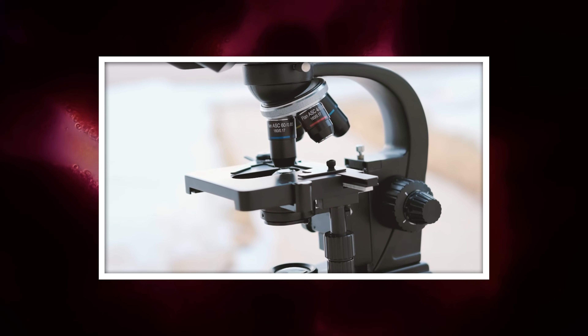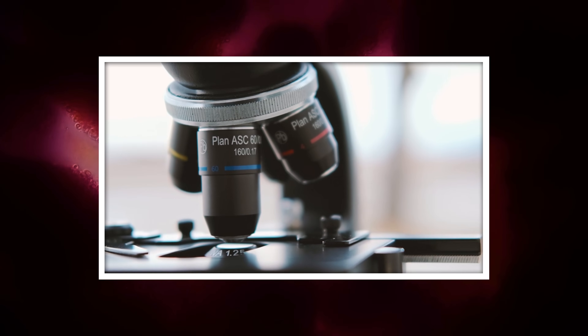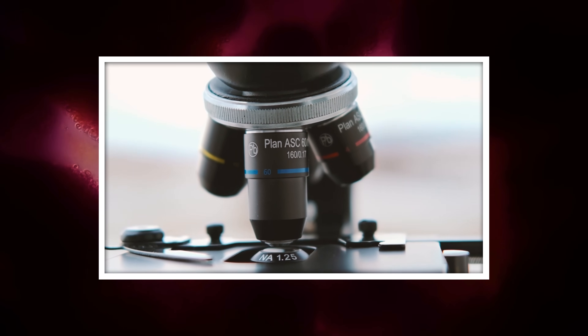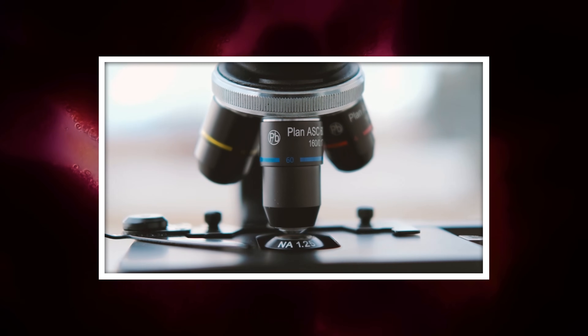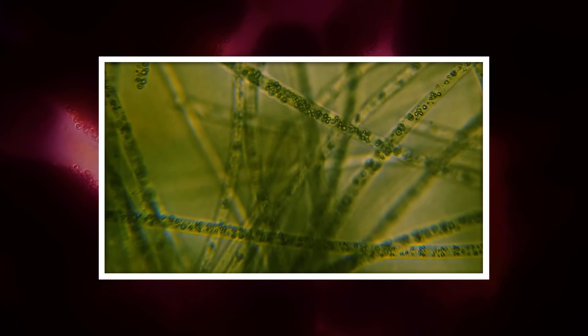We worked with our Master of Microscopes, James Weiss, to design what we believe is the perfect starter microscope for someone who wants to get into microscopy. In fact, the clip you're seeing on the screen right now was captured using our microscope.